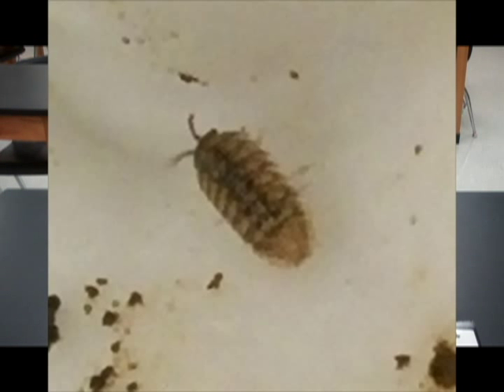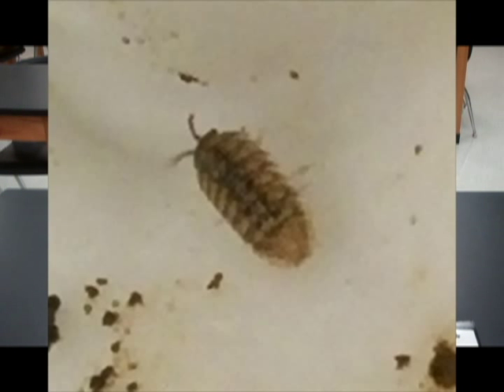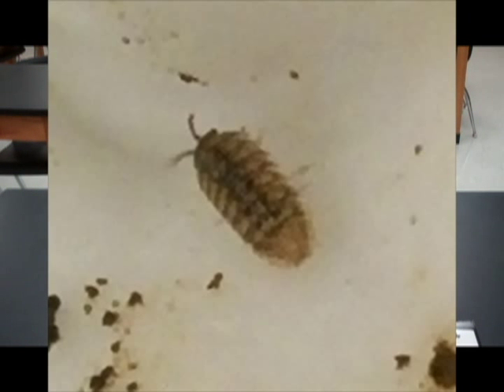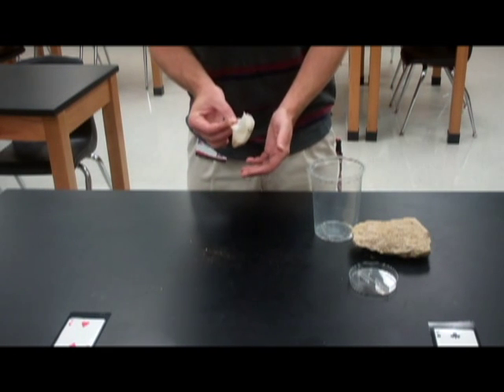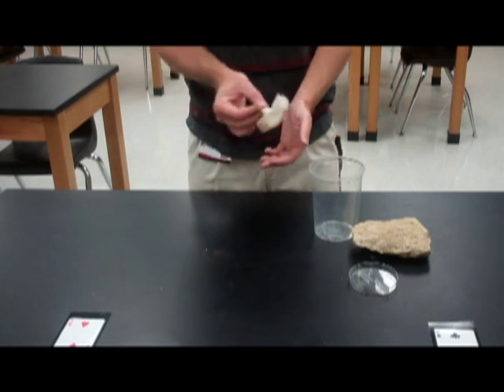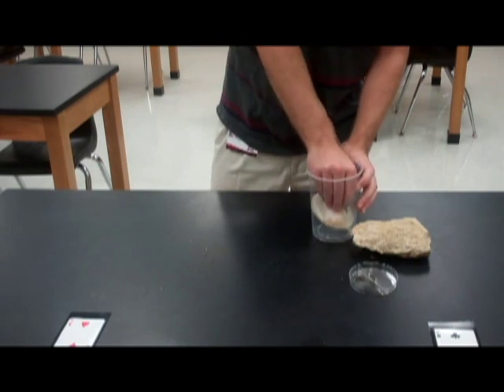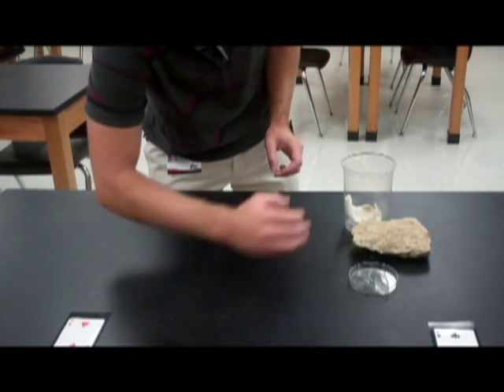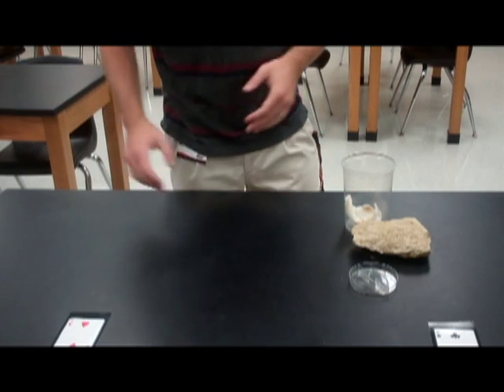Pill bugs are little bitty armored creatures, also known as wood lice, and they look something like this. They're perfectly safe and great to use for choice experiments.